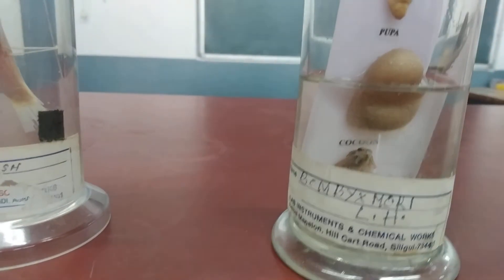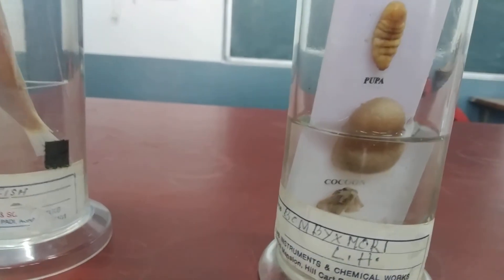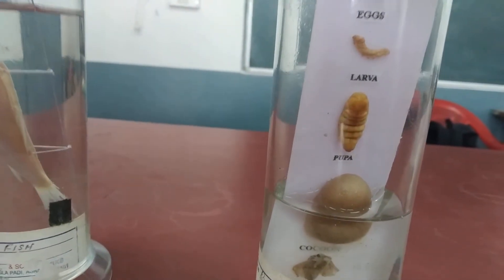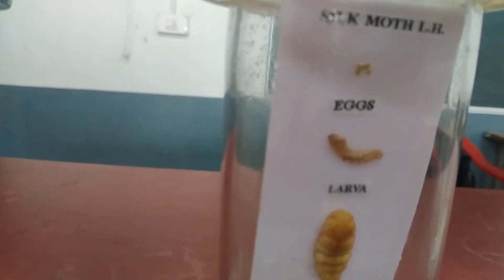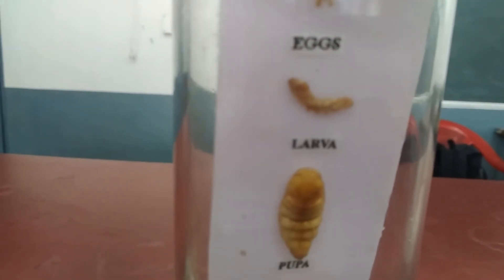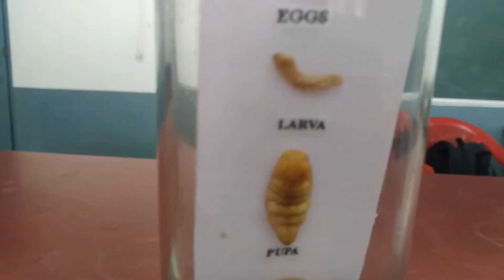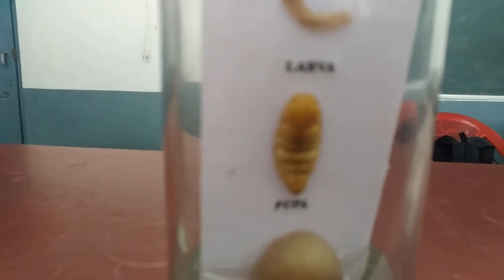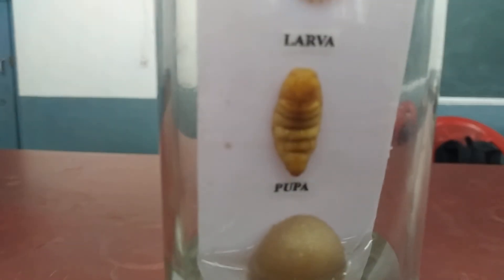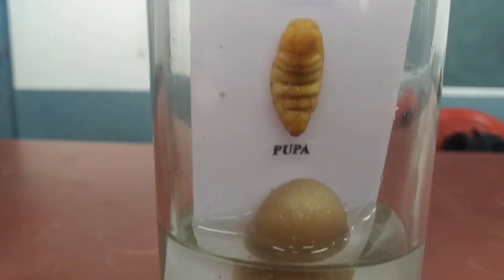The next is the silk moth. If you look at the structure properly, it contains a pair of wings and the body is again divisible into head, thorax, etc. Basically, the characters have already been provided to you in PDF form, so study the three basic characters from there.